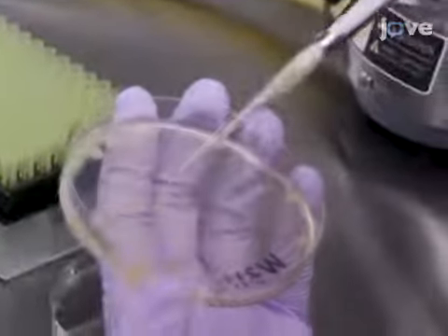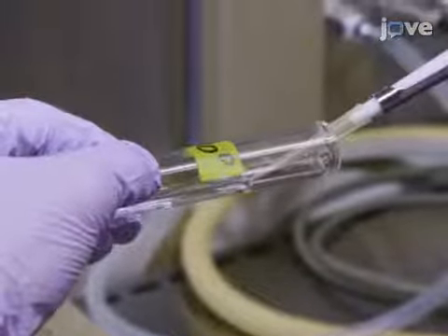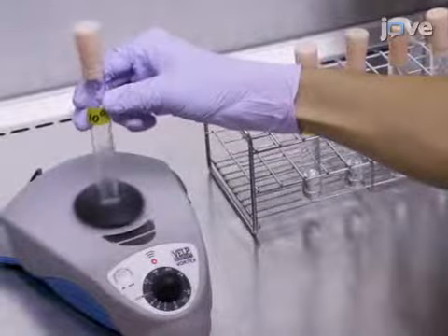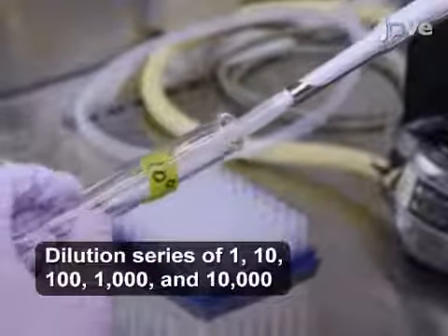Use the P200 tip to pick a colony and inoculate it in the glass tube containing 5 ml of M63. Vortex the tube to make a suspension. Then, dilute the solution tenfold by transferring 0.5 ml of this solution to one of the 4 tubes.